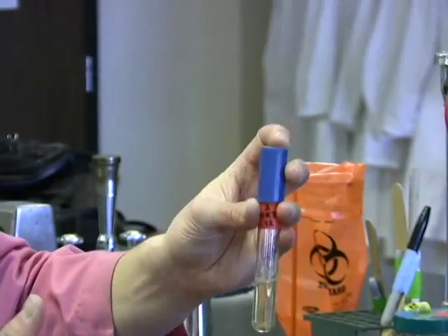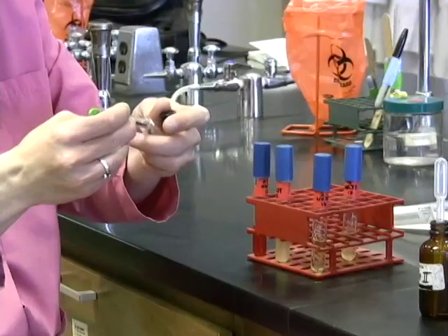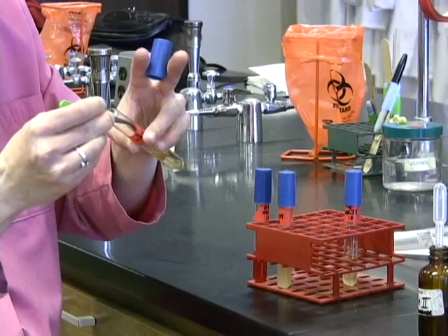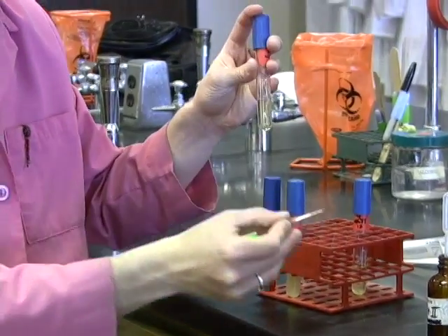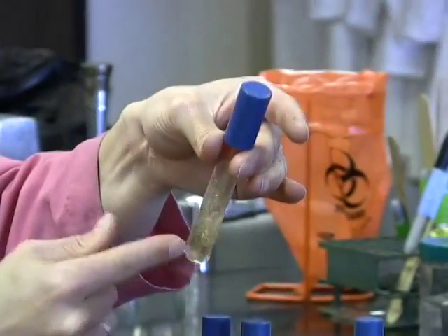But again, we see nothing in this case, so we're at the crossroads one more time where we know that it might either be negative for nitrate reduction, or it could be positive via the second mechanism of taking it beyond nitrite. So we're going to add zinc, and zinc is what tells us that, and we remember that if it turns pink, pink after zinc means that it's negative. So let's add some zinc. And once again, we need to give that zinc some time to react.